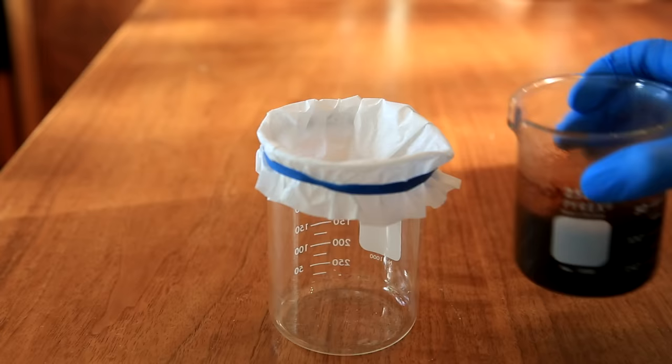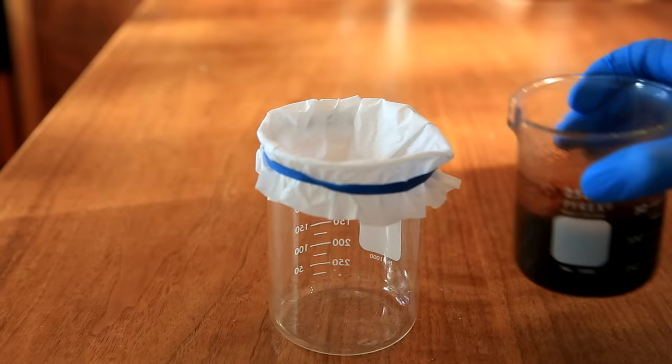After 15 minutes it can be removed from the heat and allowed to cool. Using a coffee filter will remove the coffee grinds from the solution.